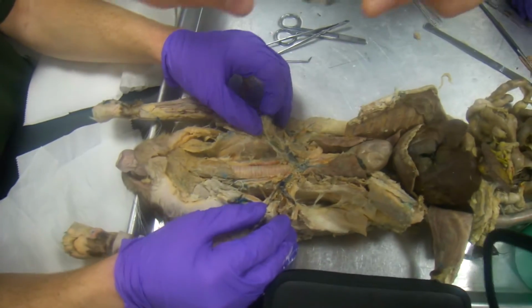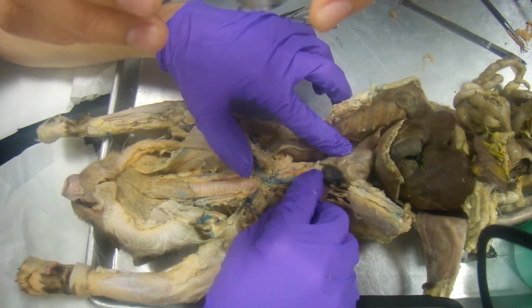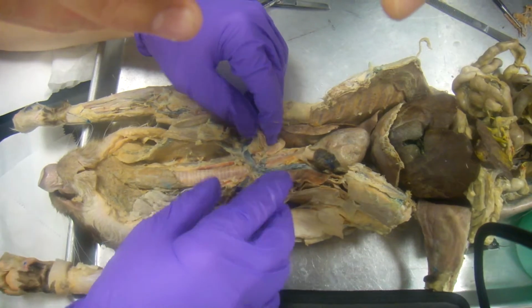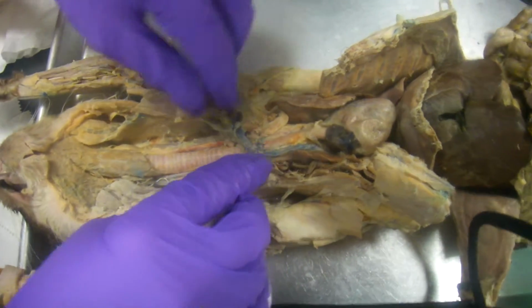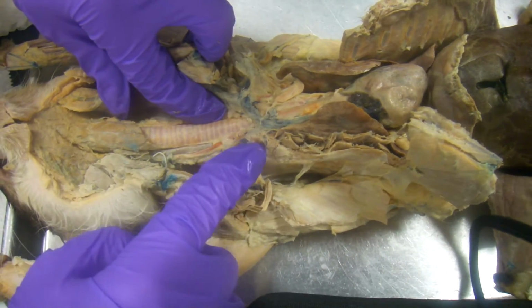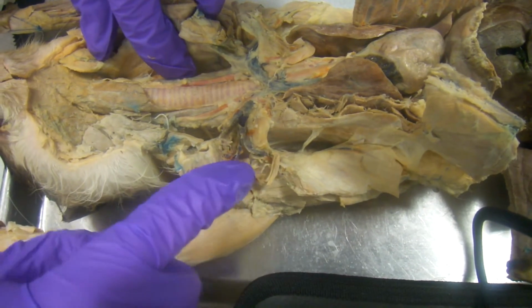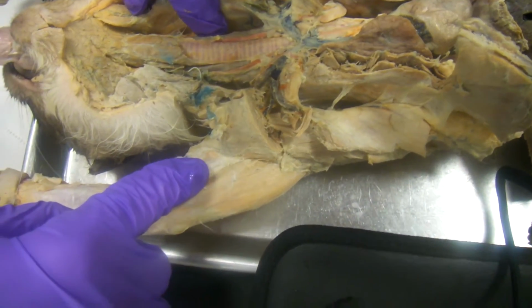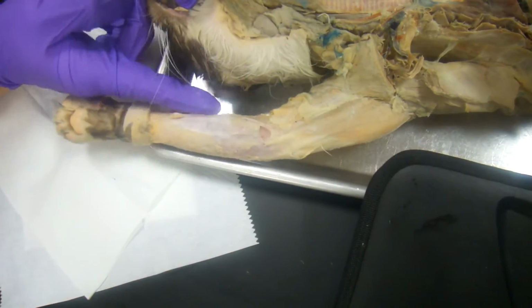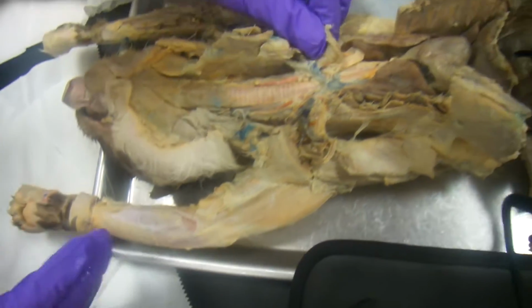And then for the artery, you're going to have the ascending aorta, the arch, then you're going to have the brachiocephalic trunk. The brachiocephalic trunk branches off into the two common carotids here, but it also continues to form the subclavian artery, and the subclavian artery becomes the axillary artery, and the axillary artery becomes the brachial artery, and radial, again closest to the head, and then ulnar, farthest away from the head. We don't have it cut, but you get the idea.